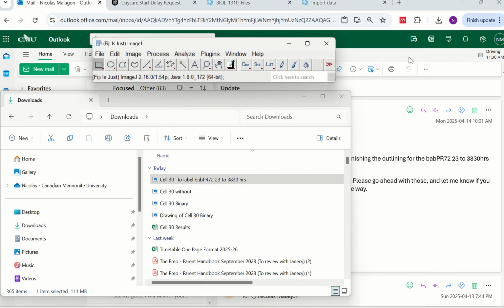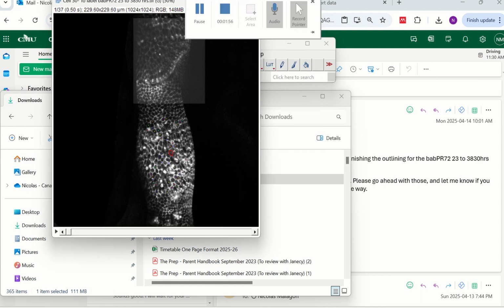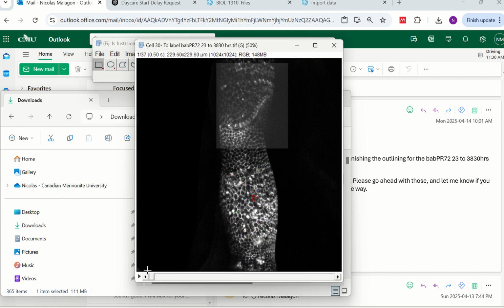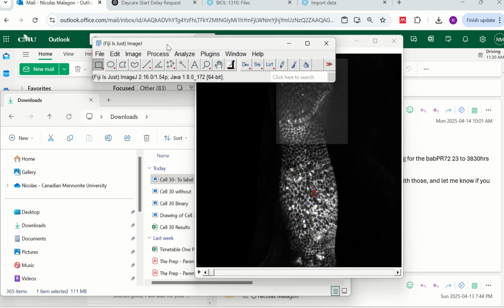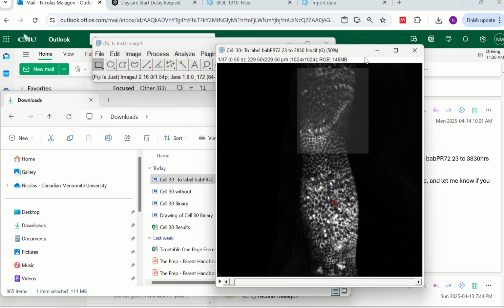It's pretty easy too, so let me show you. You open it again, and it will ask you, do you want to disable the calibration? You say, no, I want the same calibration that I have been using. If you remember, it's 4.46. If you have any doubt, you can go to the last slide, as I showed you last time. You can see that, as we changed it last time, here is the calibration. So we keep that one.